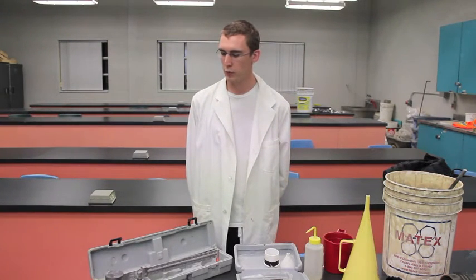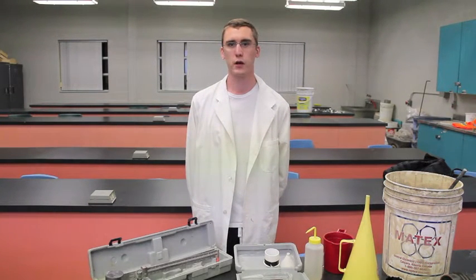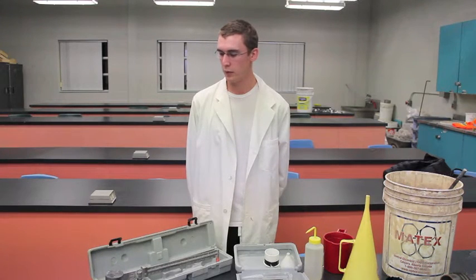Hello ladies and gentlemen, my name is Ben Miller and today I'm going to be walking you through the three steps to test our mud when we're drilling down hole.